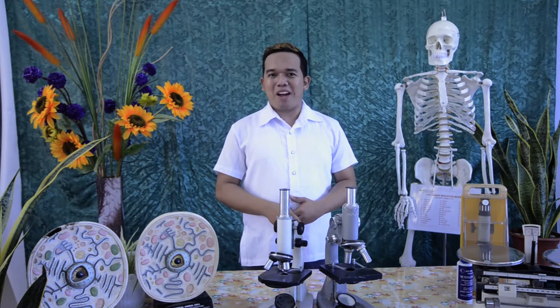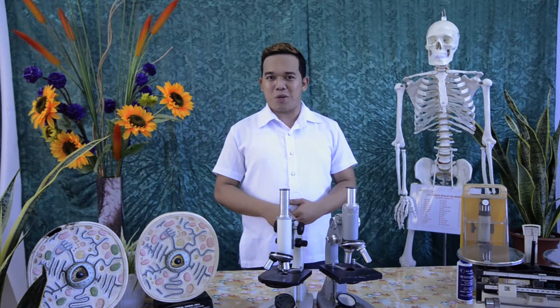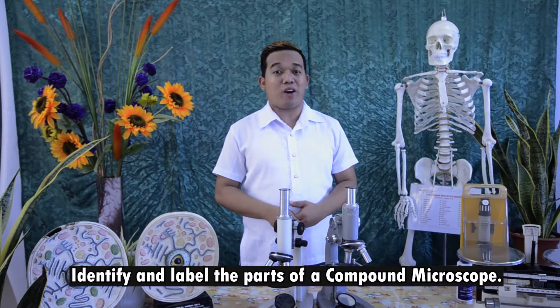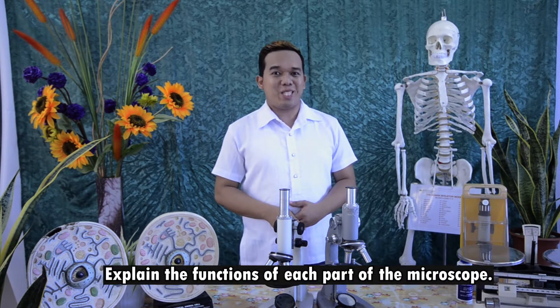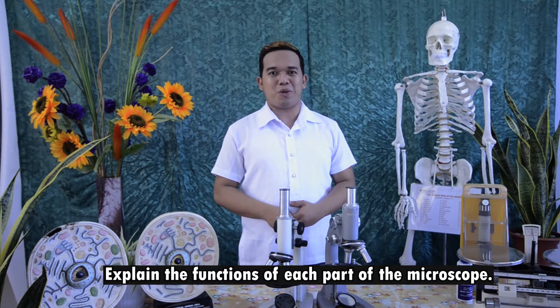Today, we will talk about the parts of the compound microscope and their functions. In this lesson, you are expected to identify and label the parts of a compound microscope and explain the functions of each part of the microscope.